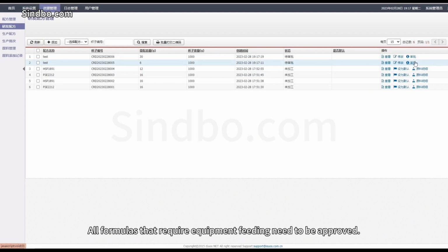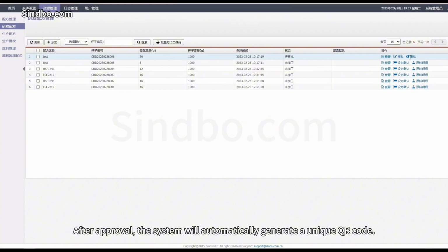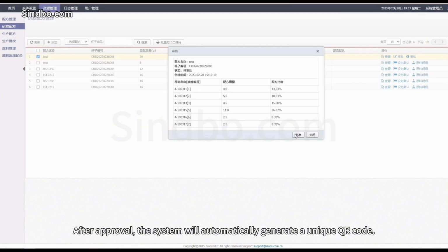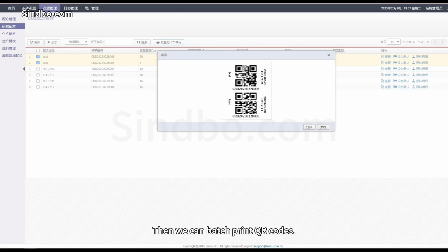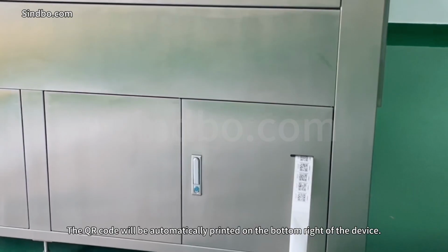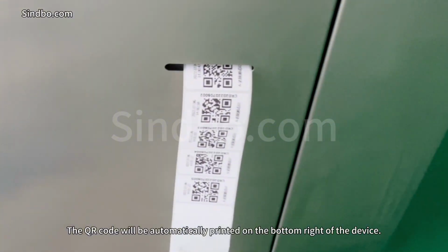All formulas that require equipment feeding need to be approved. After approval, the system will automatically generate a unique QR code. Then we can batch print QR codes. The QR code will be automatically printed on the bottom right of the device.